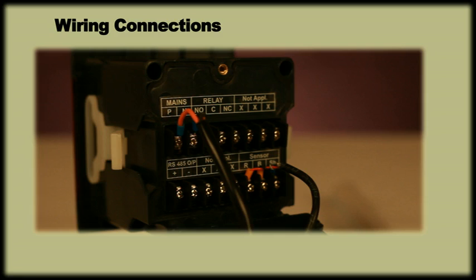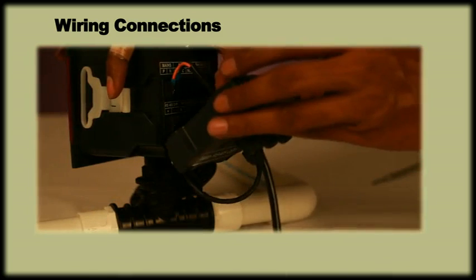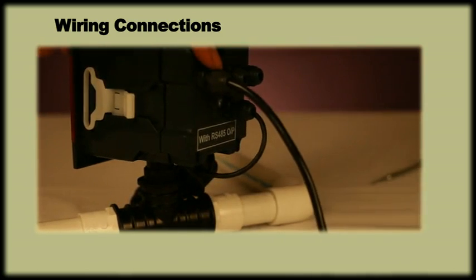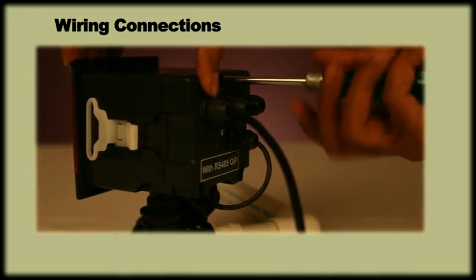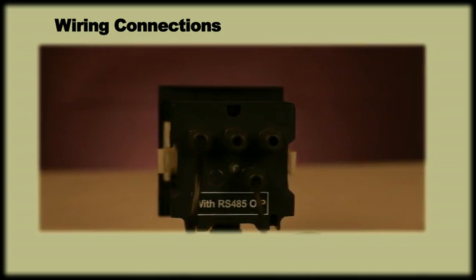The supply voltage should be 230V AC plus or minus 10% unless specified. The cable used must be round and of 6-8mm in diameter. While closing the hinge cover, any extra length of cable has to be pulled out of the glands, such that the hinge cover can be closed tightly, thus keeping it IP65.